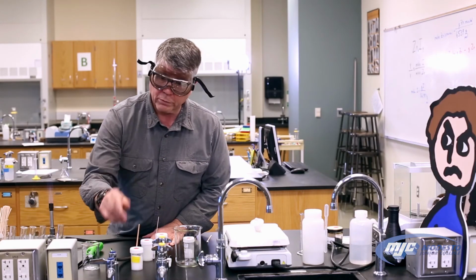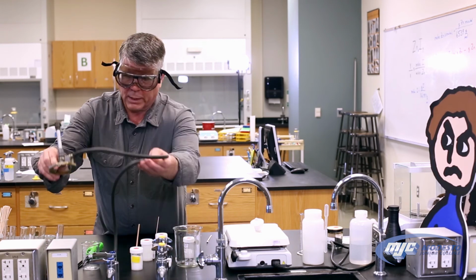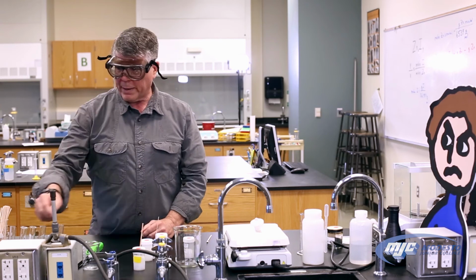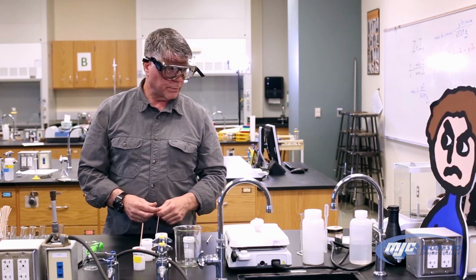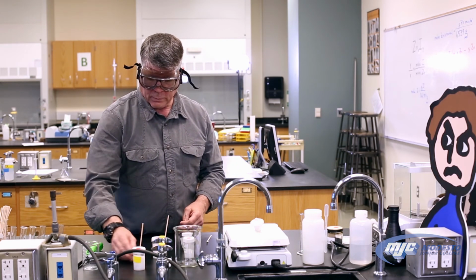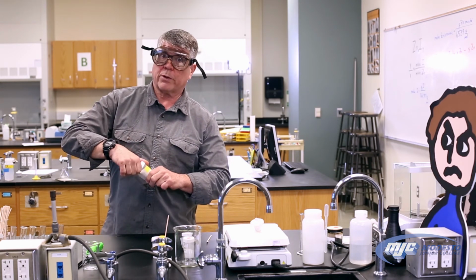So we're finished with the flame, so we just turn it off here, set it aside. The top's going to be hot, the bottom's not. So now we're ready for our magnesium strip test. So take a small test tube from your locker. Take your unknown. Again, this comes from the test tube that you got your unknown in.